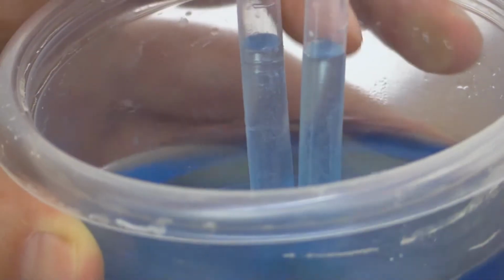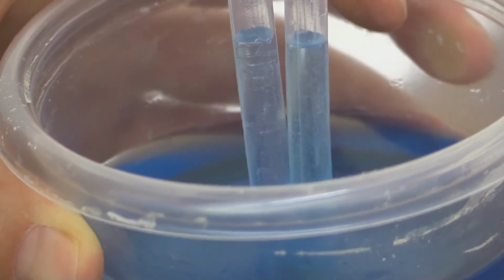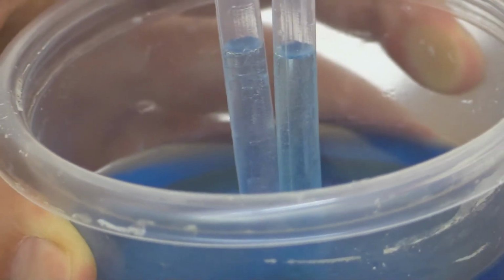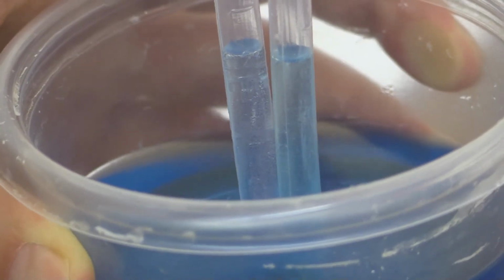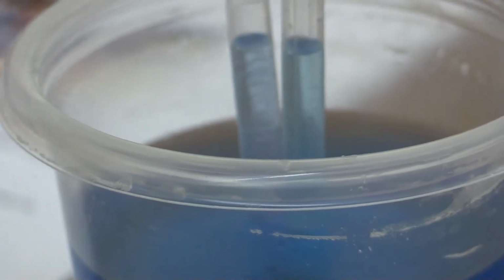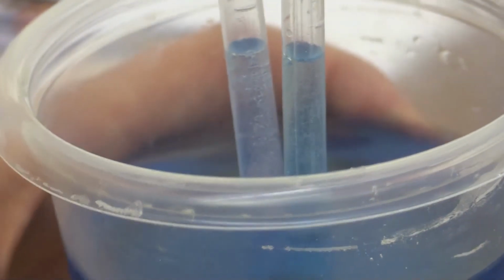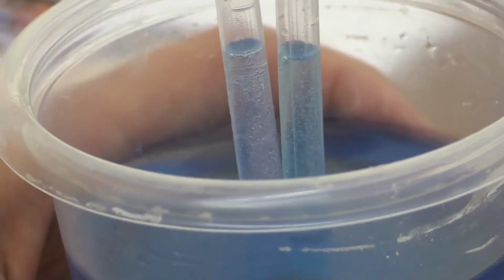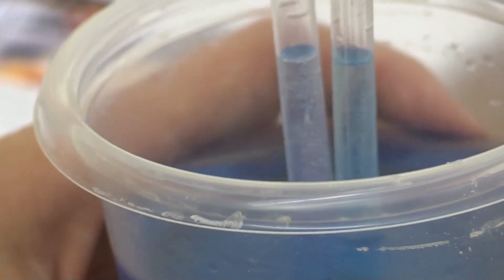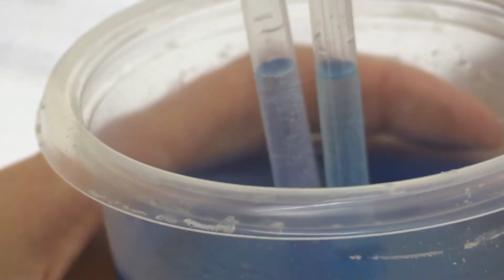And you should see that it starts to produce gas pretty quickly, and you'll see more gas produced at one contact than the other. As this reaction goes on, you'll start to see a change in the color of the indicator solution, with the side that is producing the oxygen getting more acidic and the side that is producing the hydrogen gas getting more basic. And so they'll watch this go for a few minutes and can make different observations with it.